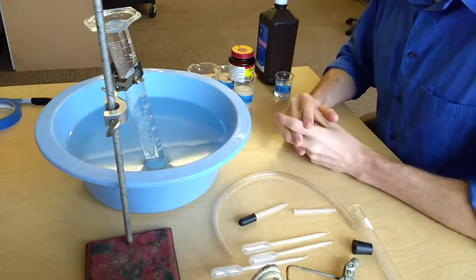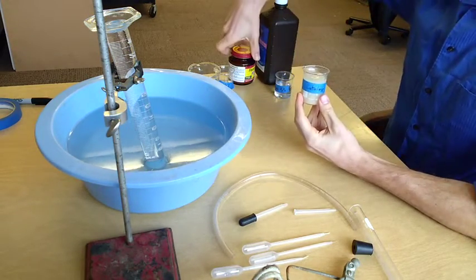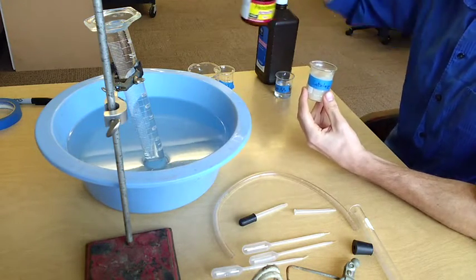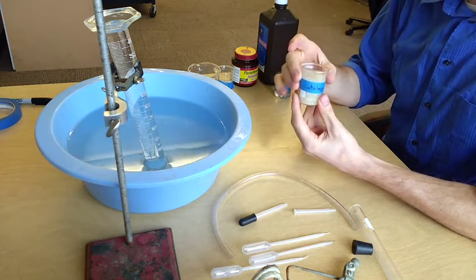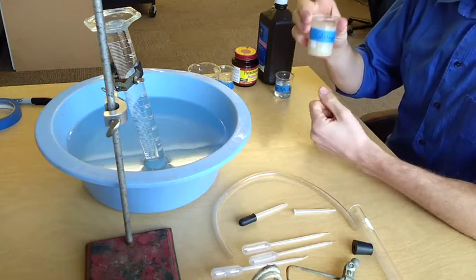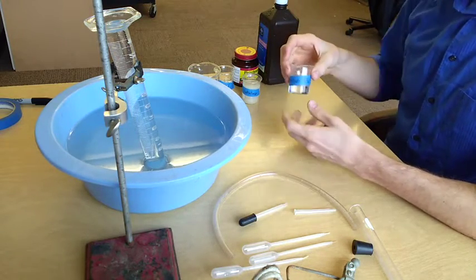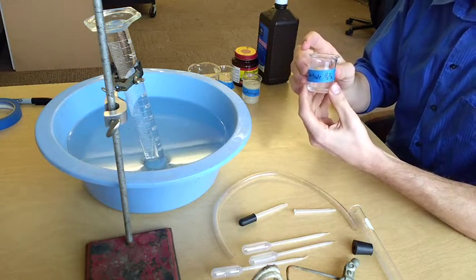In this lab, you're going to be measuring the reaction rate of an enzyme which is found in most living cells, including yeast. This mixture of yeast and water has an enzyme in it called catalase. Catalase reacts with another molecule called hydrogen peroxide, H2O2.